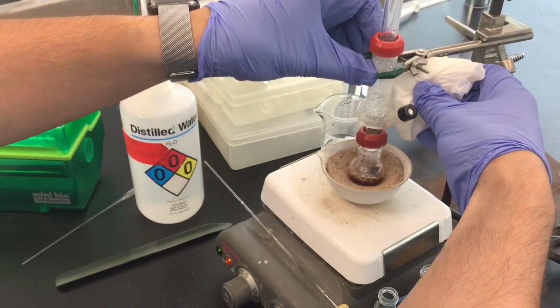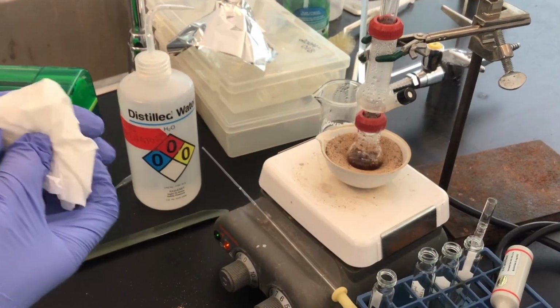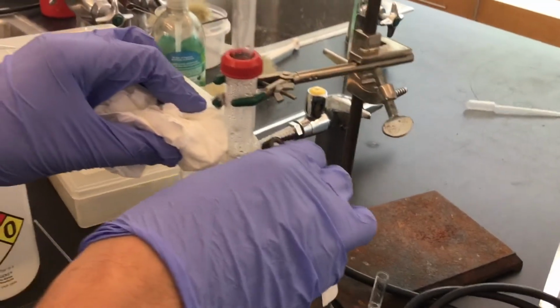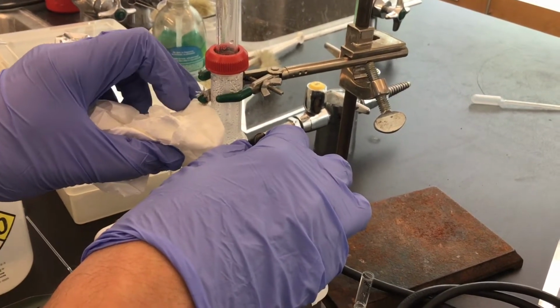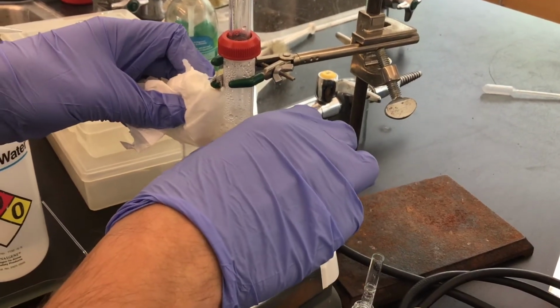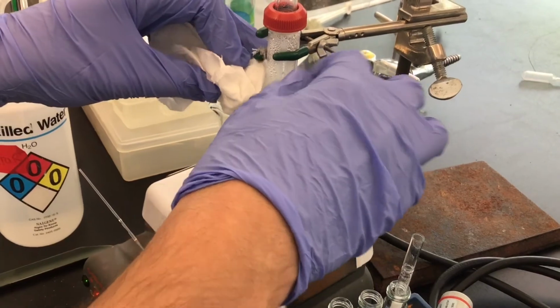I was growing impatient, waiting for the distillation to speed up. But what I've decided is that I put a little bit of chipped ice in a paper towel, and I'm just touching the edge of the still here, so that the distillate, the steam, the vapor, will condense faster and hopefully pool under here at a faster rate as a result, because it's now got cooler glassware up here to then condense on.